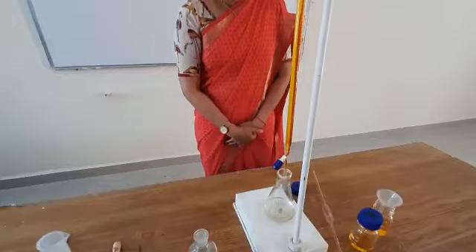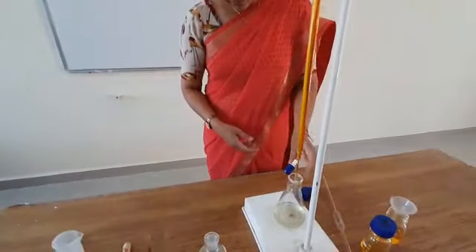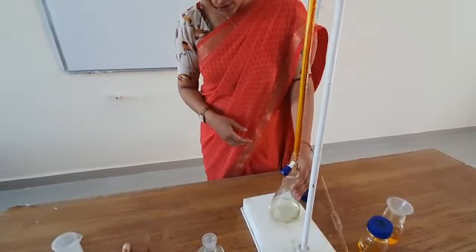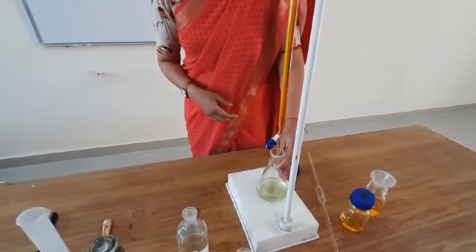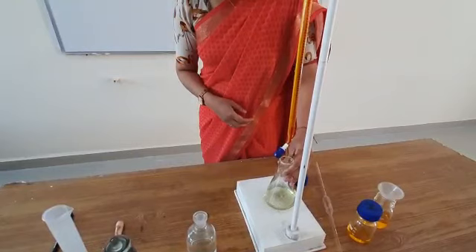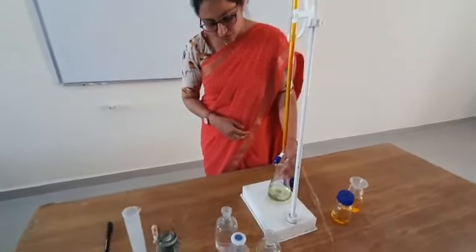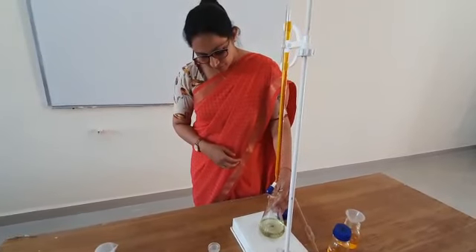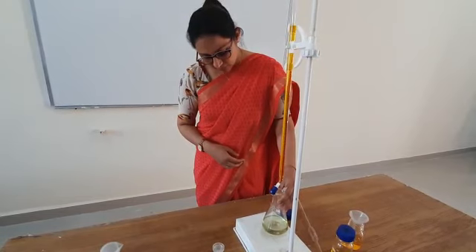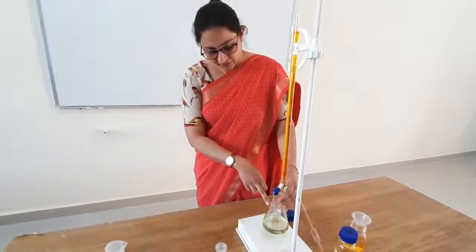As you can see, the color is changing. The solution was colorless, and now we are getting a purple color. This is due to the quinoid formation of diphenylamine — diphenylamine has two phenyl groups, and during the reaction these phenyl groups get converted into the quinoid form, whose color is purple. You can see the appearance of purple color with each drop.